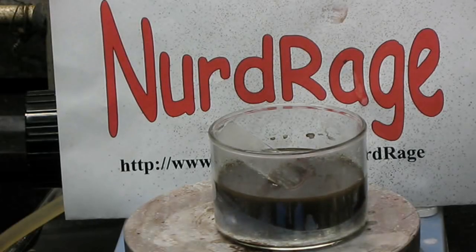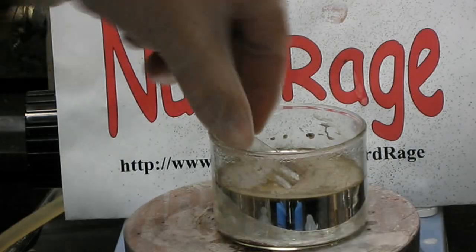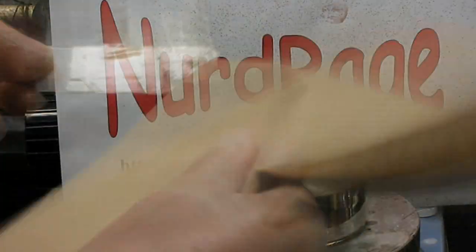As you can see, the silver is now depositing onto any surface it contacts, including the walls of the container. Let me get the slide out to remove the tape and clean off the waste.